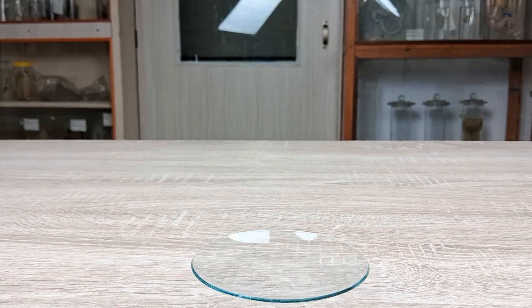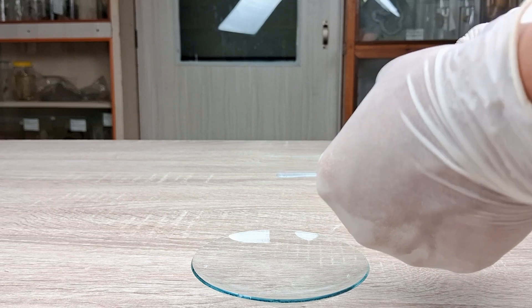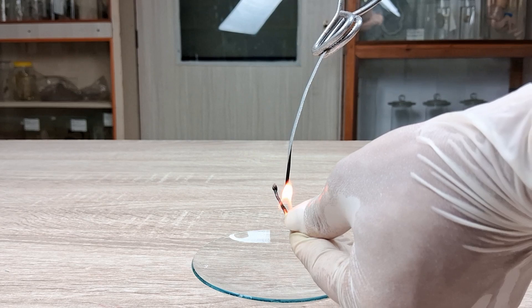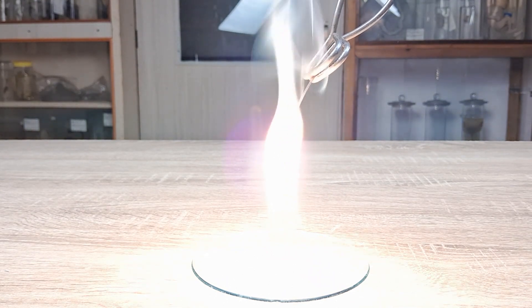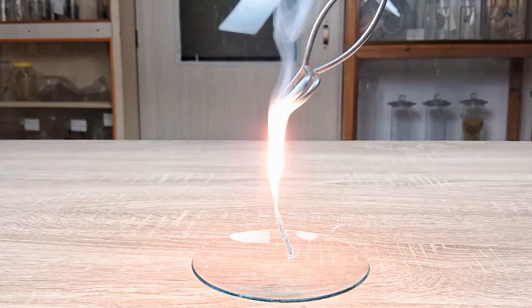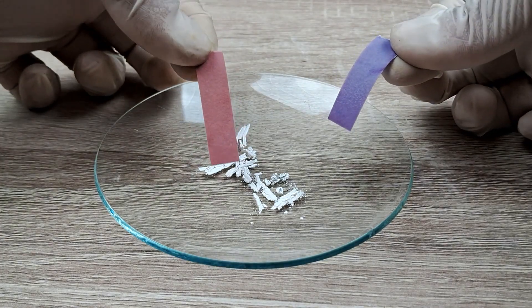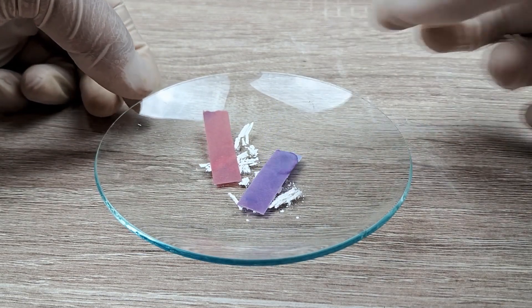To perform this second experiment in combination reaction, take a piece of magnesium ribbon about 7 to 10 centimeters long. Hold one end of this ribbon with a pair of tongs. Now light the other end of the ribbon using a lighter or matchstick until it starts to ignite. Collect the white residue formed in a petri dish or watch glass. Test the acidic or basic nature of the residue by touching it with a strip of blue litmus and red litmus papers moistened with water. Record your observations.